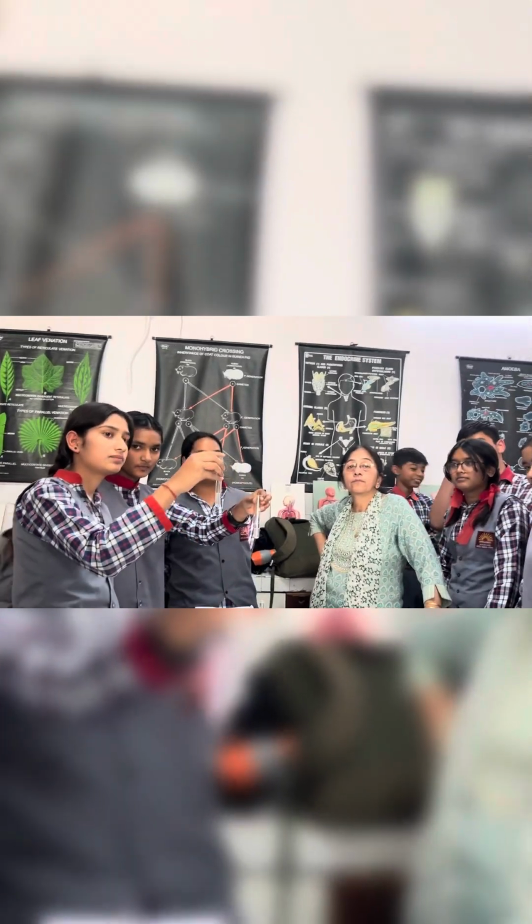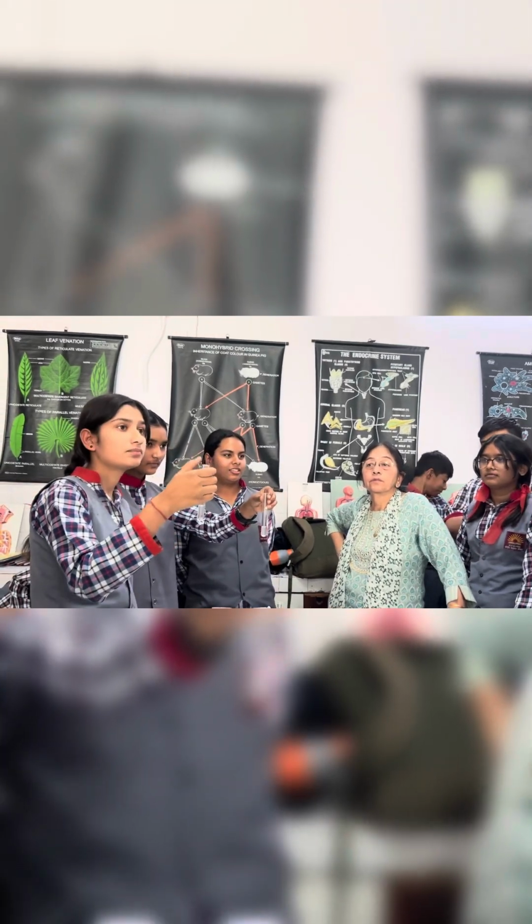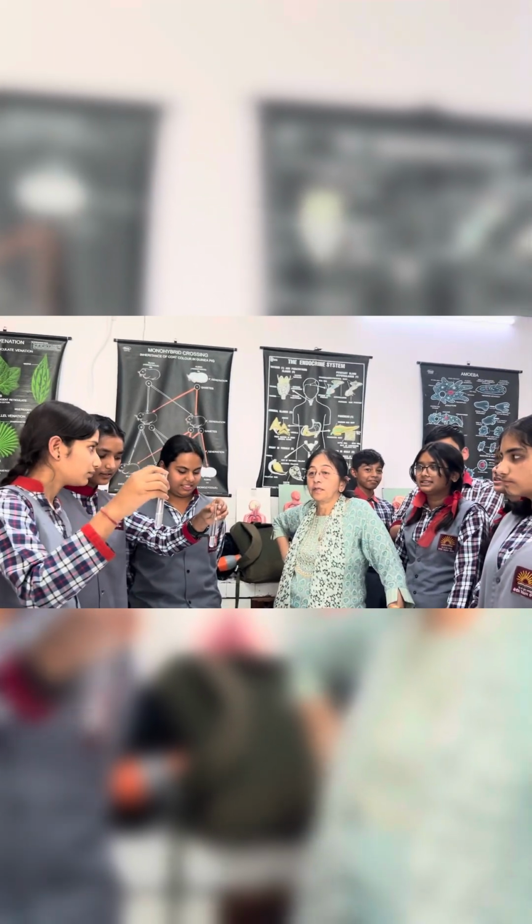Mix it well. Now see the color of these solutions. What is the color of the solution? Now we are going to mix both the solutions.